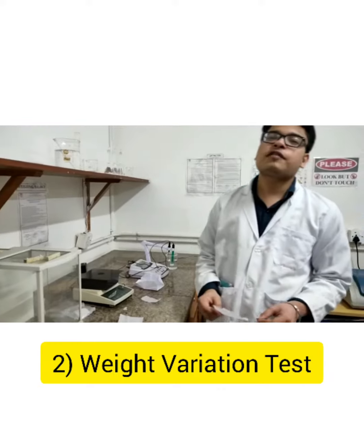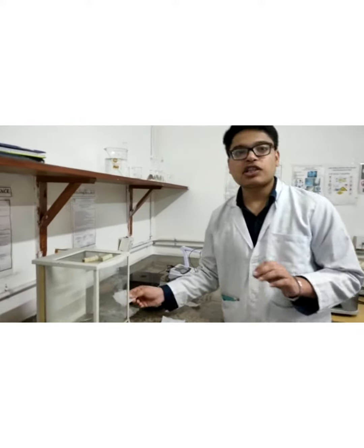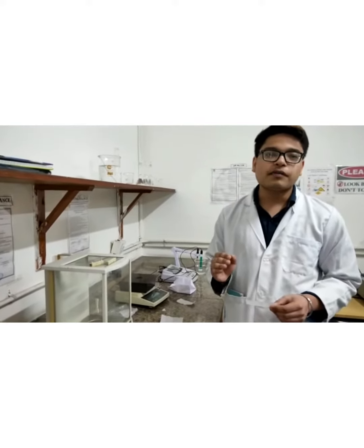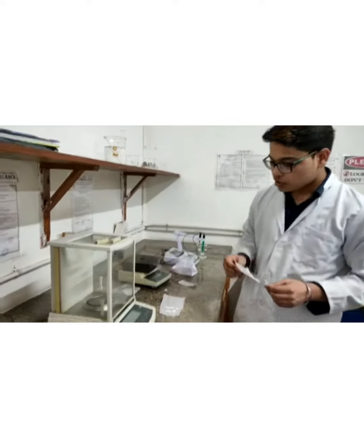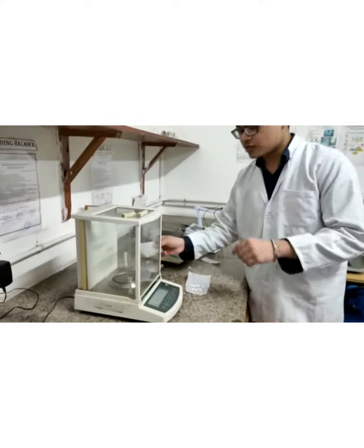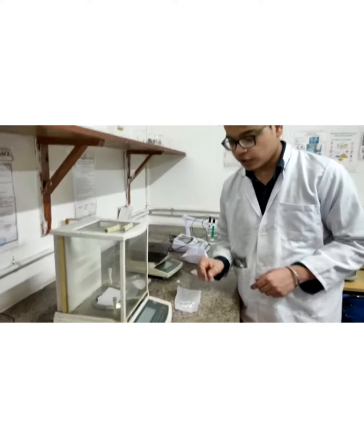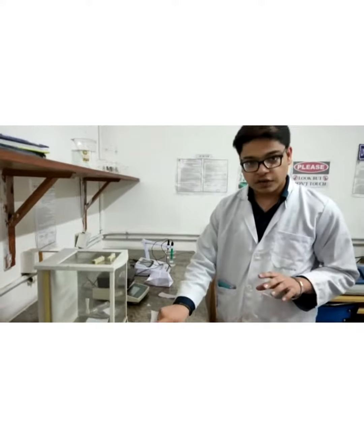The second test is the weight variation test. We are going to weigh each tablet, calculate 20 tablets, and then calculate their average. Then we are going to compare the average weight with that of the single tablet to calculate the weight variation. As you can see, I am now putting butter paper over here and going to tare the weight.